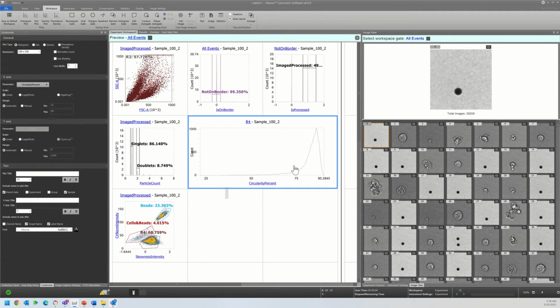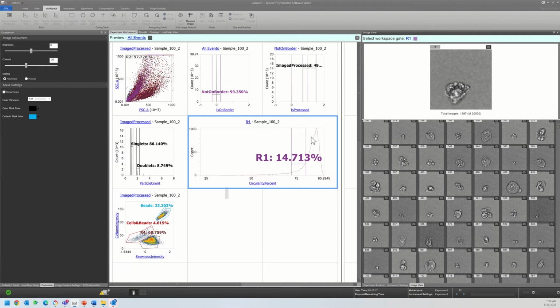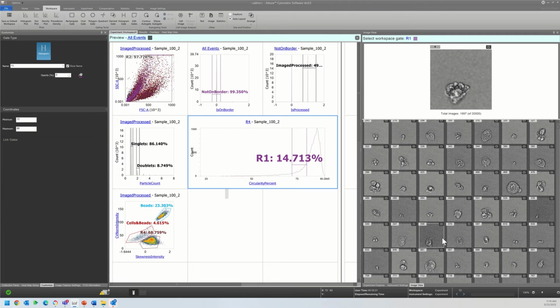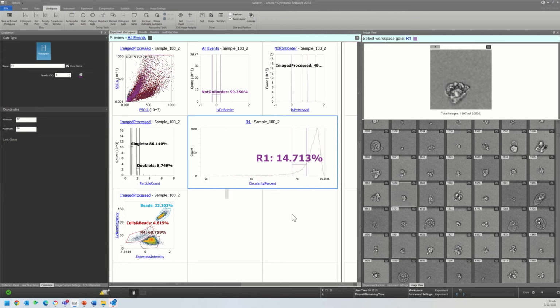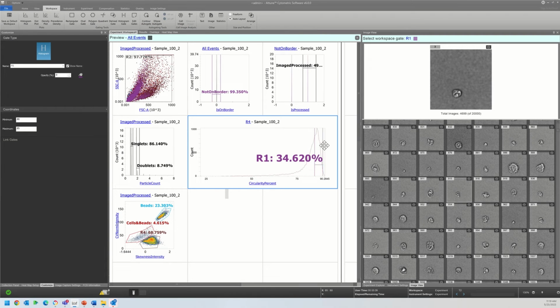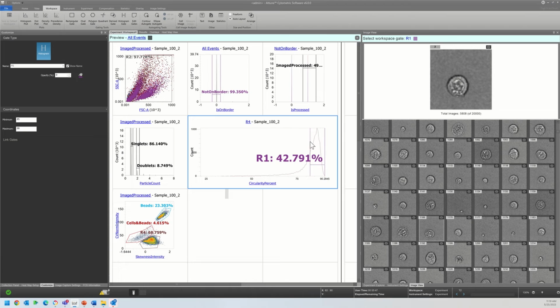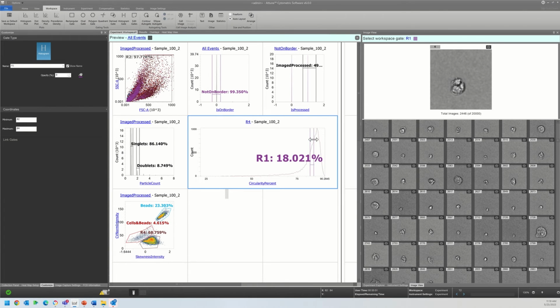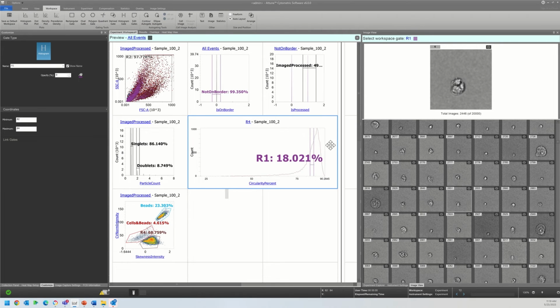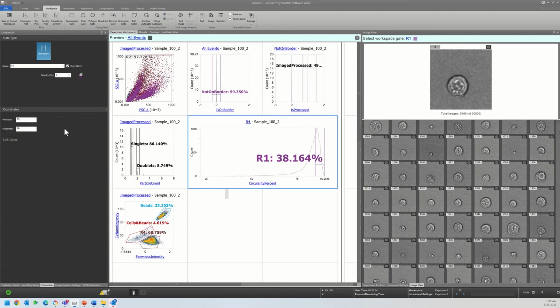I know for the most part that everything below around 80 is going to be debris and dead and dying cells. And so as a general rule, with a lot of my dissociations and really messy samples, I'll gate out anything below 80% circularity, just as a general rule of thumb to help clean up my sample. So if I look here, you can see 72 to 80, that's my range. If I go up a little bit, we're starting to lose some of those cells and debris. I might actually gate everything out below 85 in this sample because it is so messy. But it's up to you depending on what you are trying to assess with your sample. So if this was mine, I would just say everything below 85 can go, and I would set my lower threshold at 85 and only go forward using this sample of cells.